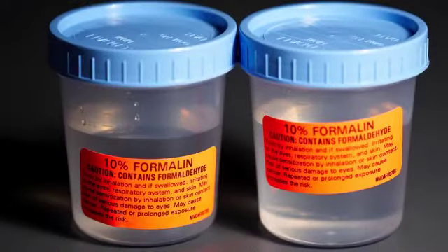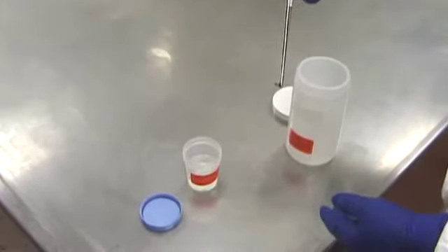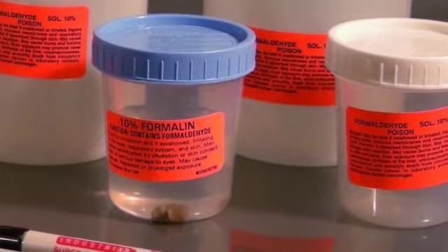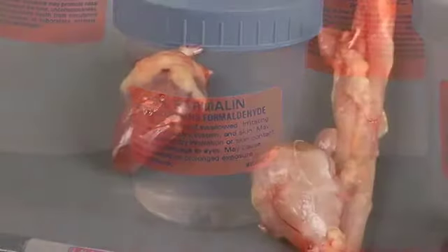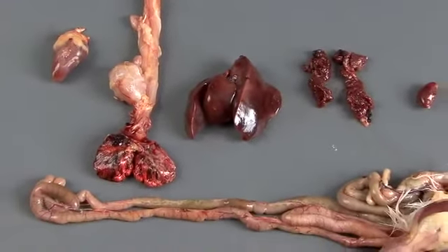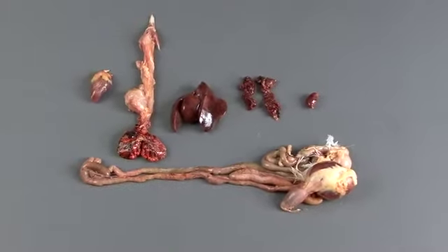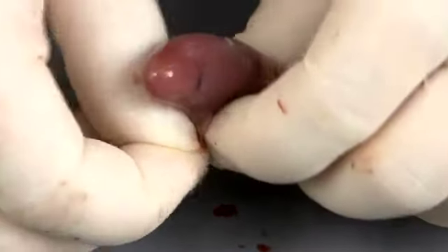After approximately 24 hours, the tissues will be fully fixed. The tissues can then be moved to smaller, tightly sealed containers or bags with just enough formalin to keep them wet. These smaller containers are generally easier to ship or store. The sequence of organ evaluation generally doesn't matter. The exception is the gastrointestinal tract, which is normally saved for last to prevent the contamination of other organs with intestinal content. The heart can be opened and its chambers evaluated.